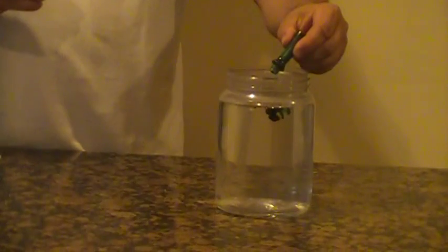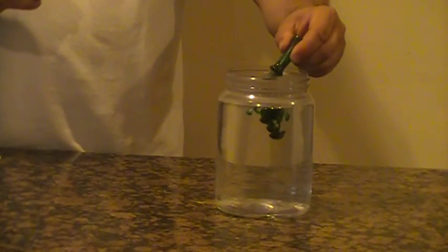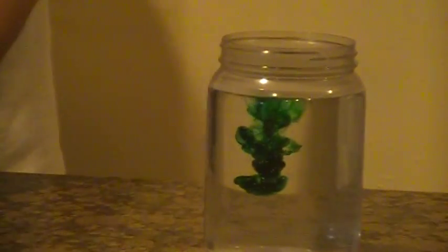One, two, three — let's add one more — four drops of green dye into the water.